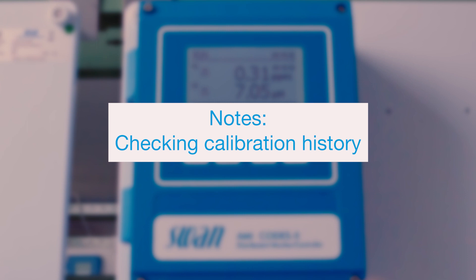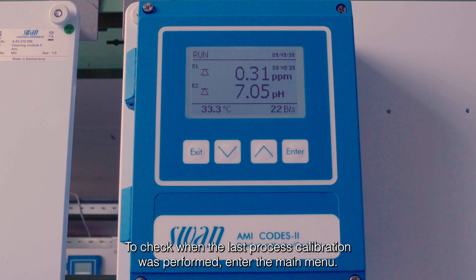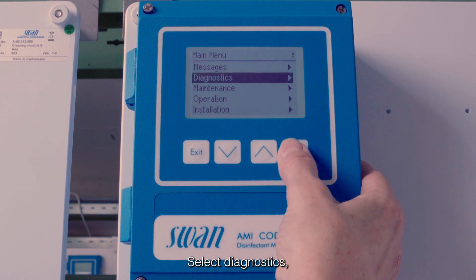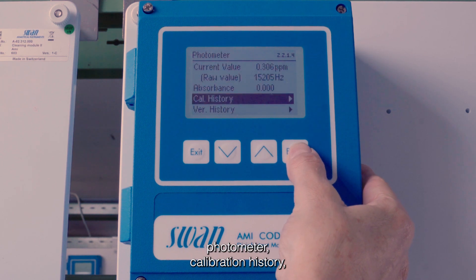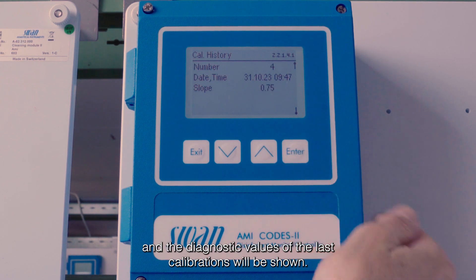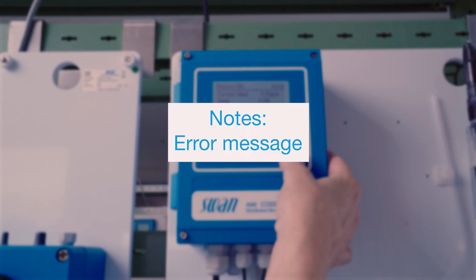Checking the process calibration history: to check when the last process calibration was performed, enter the main menu, select Diagnostics, then Sensors, then Photometer, then Calibration History, and the diagnostic values of the last calibrations will be shown.